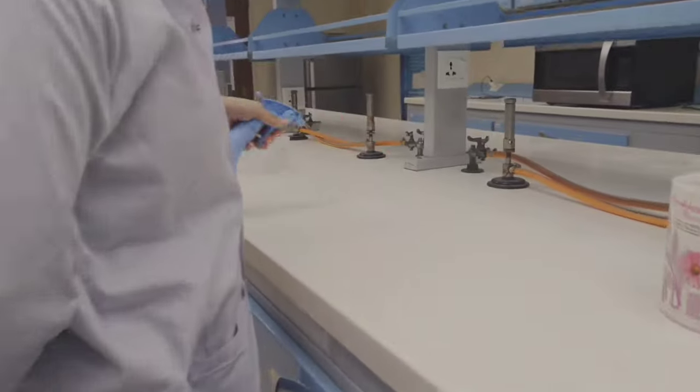Now our step is disinfection. In this step, we perform disinfection with 75% alcoholic solution.